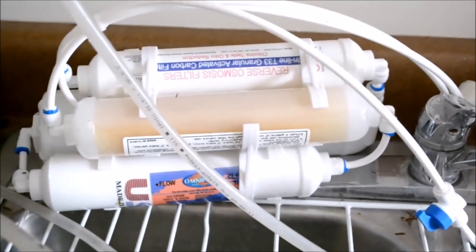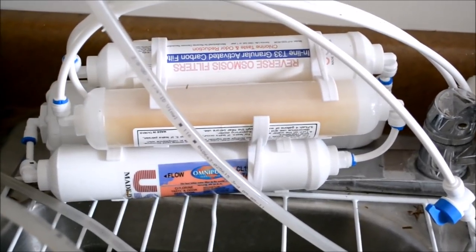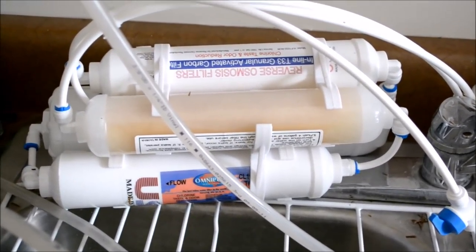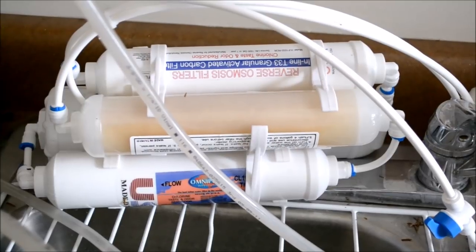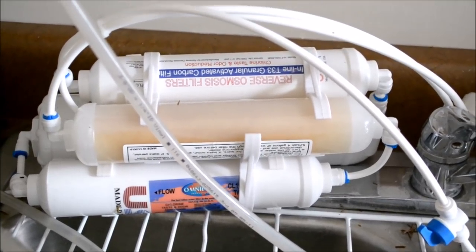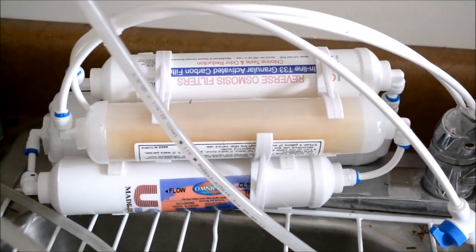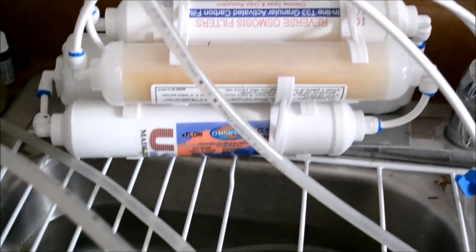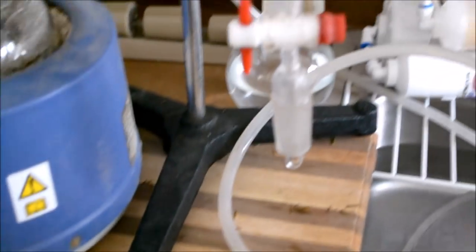A reverse osmosis filter is really good for this kind of work to keep your chemistry glassware clean, and also for distillation purposes, distilled water is the best. And I just want to show you, this is a normal everyday fish tank aquarium pump, and it simply pumps the water.